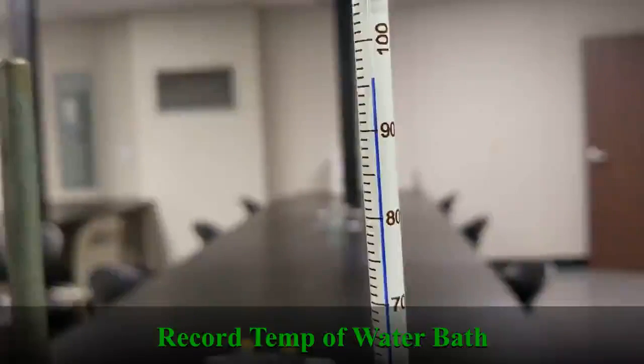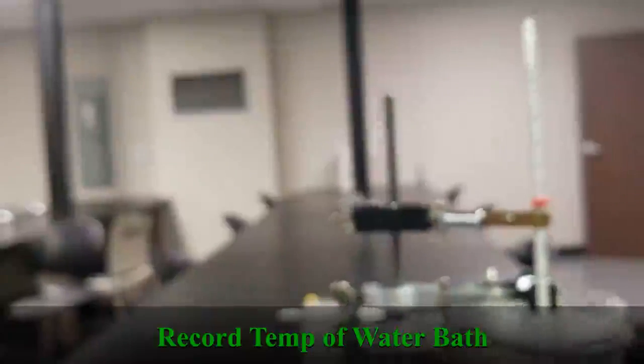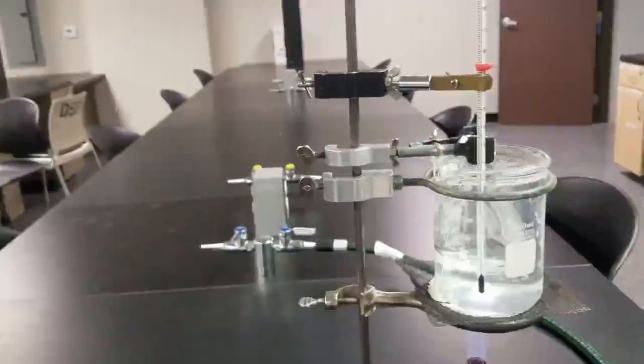Go ahead and make your reading. Remove that Erlenmeyer and then just let it cool to room temperature and then weigh it.